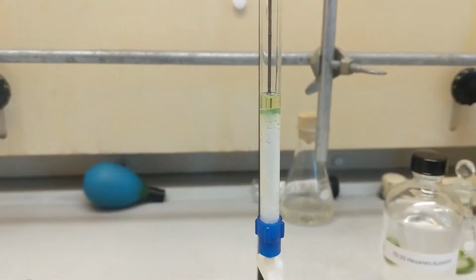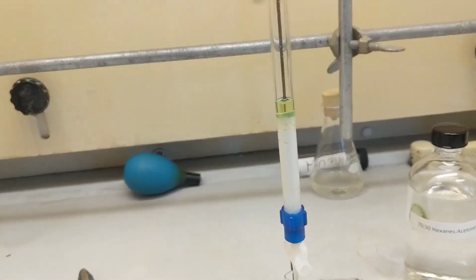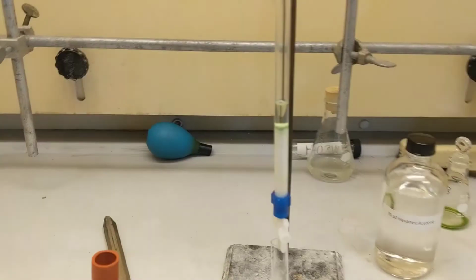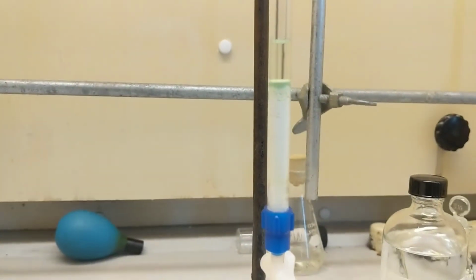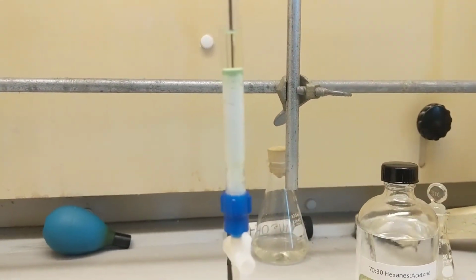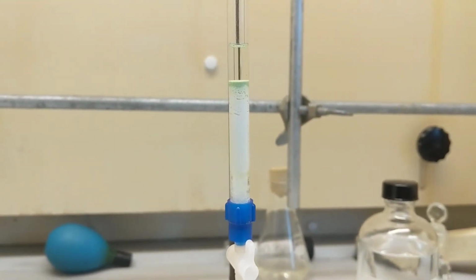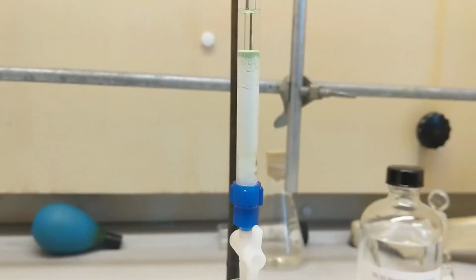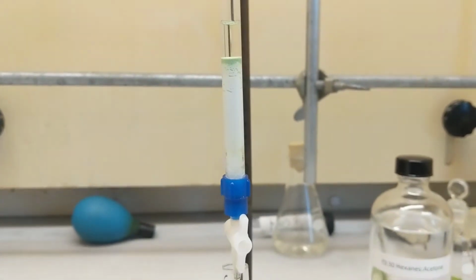Now I'm about to add just pure acetone in, which is a little more polar, and hopefully pull out my green and blue bands. Alright guys, this is the pure acetone. As you can see, it's not really pulling a band down. About that much is going through. I'm not feeling it, so when it finishes going through, I'm going to add an acetone methanol 80-20 mix. Maybe that'll get my band moving.